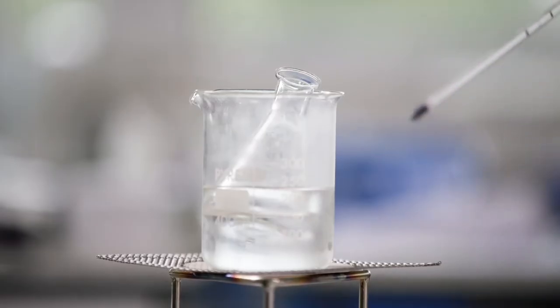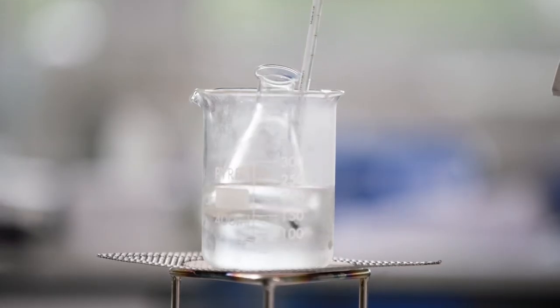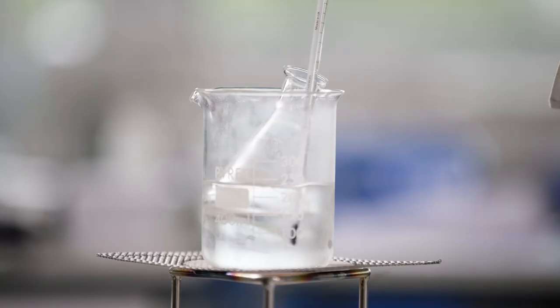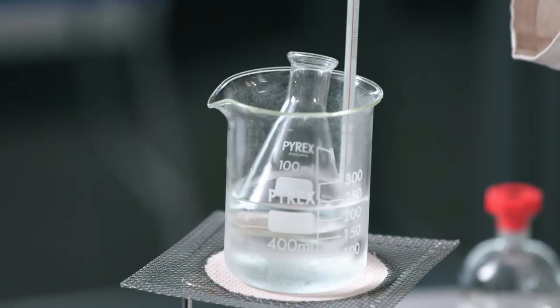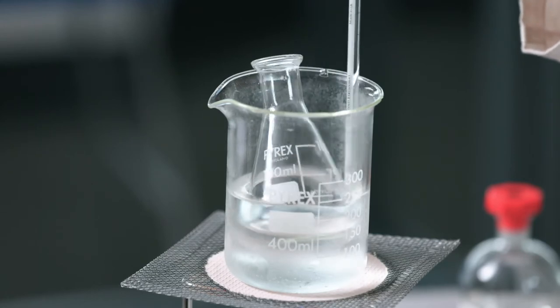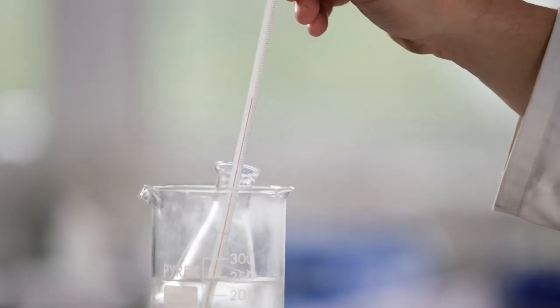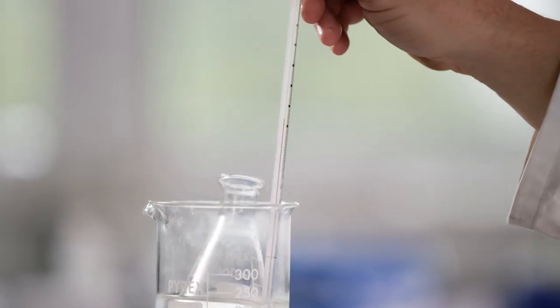In this example, I'm using a 400 centimetre cubed beaker as a water bath. However, if you use a large water bath, it is advisable to clamp the conical flask to prevent it falling over. Take care the water is no hotter than 50 degrees C, as this may scald.